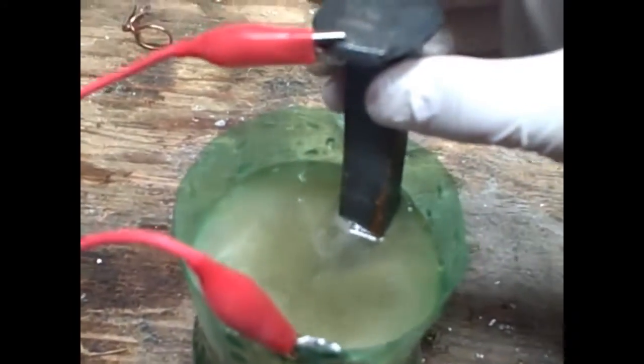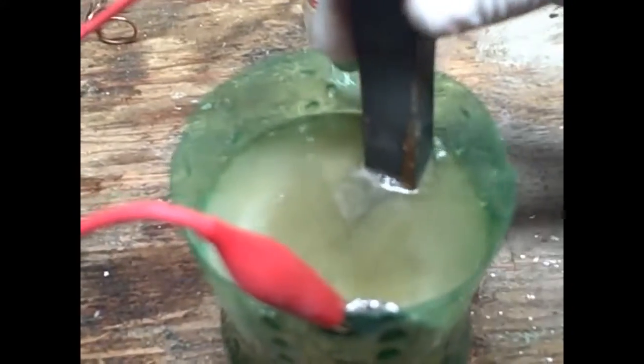So as you can see, it's clearly quite bubbling from the negative side, I believe. That's the positive side. Sorry, the wires are mixing. Yeah, this goes... yeah, the positive side. So the aluminum's on the positive side.